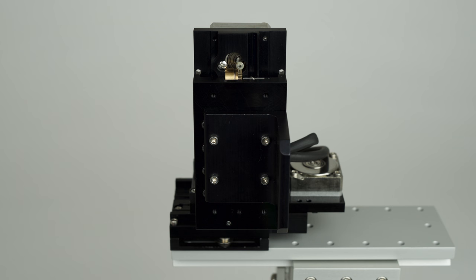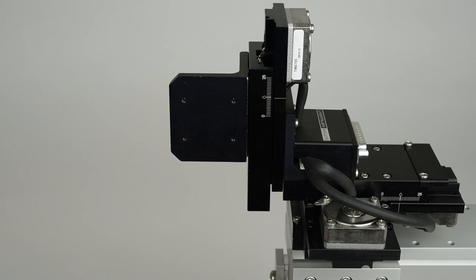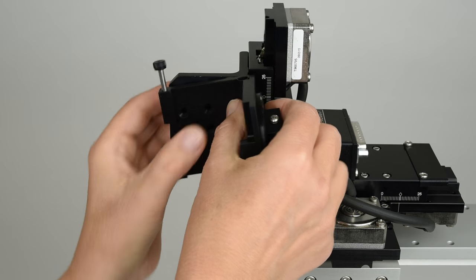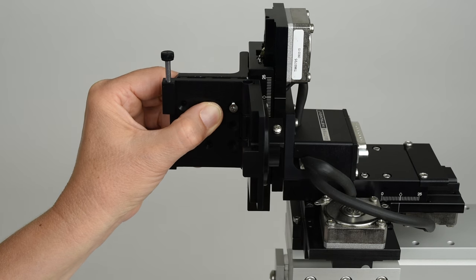Now, rotate the manipulator 90 degrees clockwise. The swing gate then attaches to the right angle adapter using the Phillips screws.